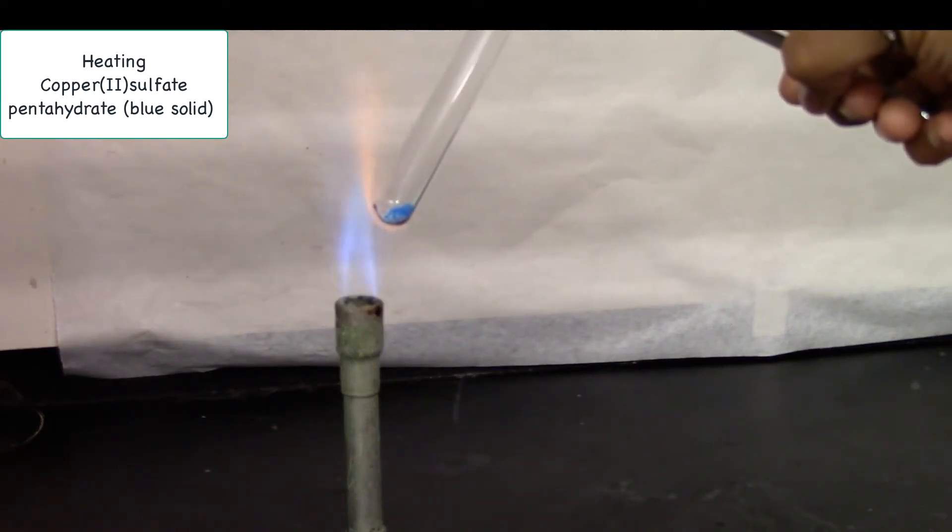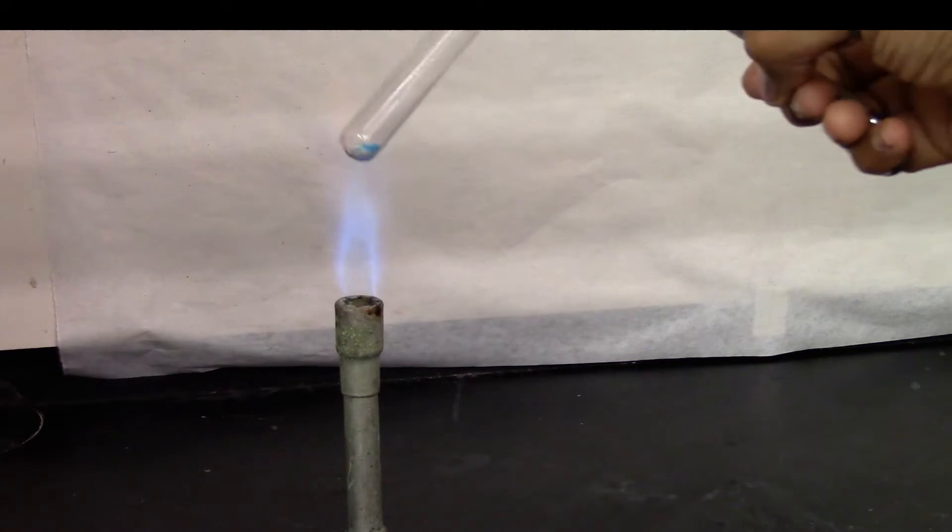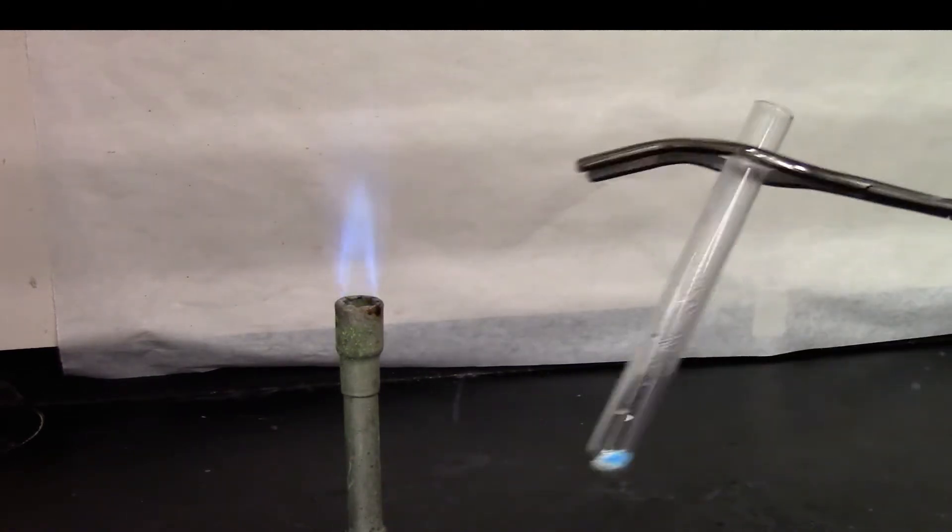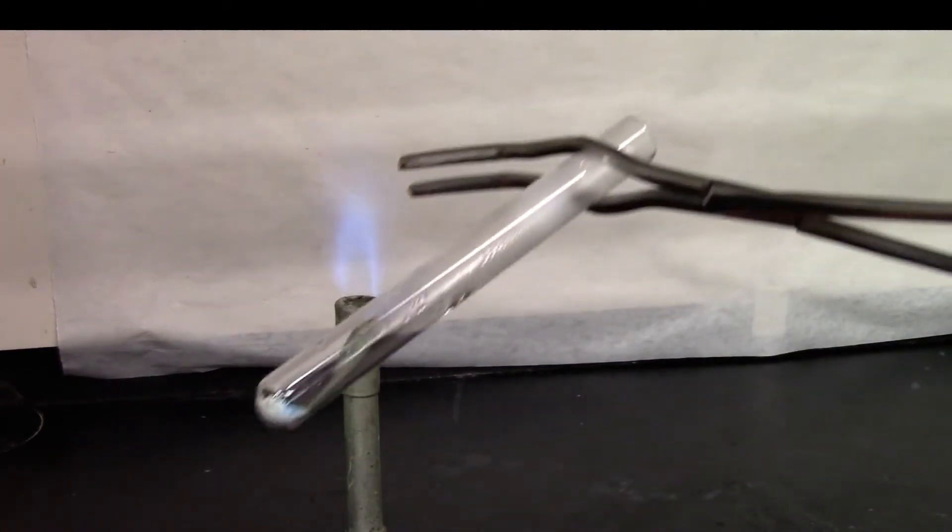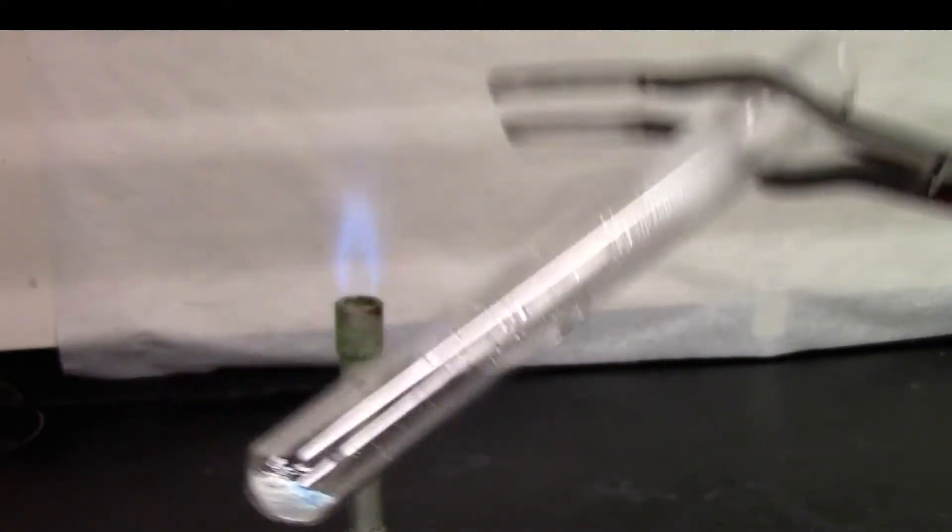And we'll see how it changes. So you can clearly see there is some condensation on the test tube.